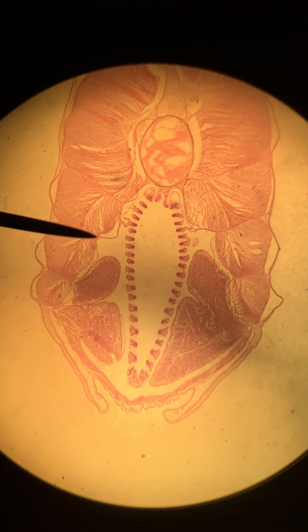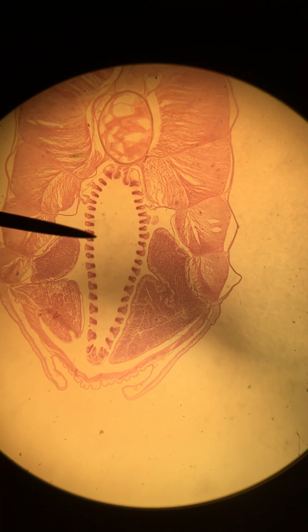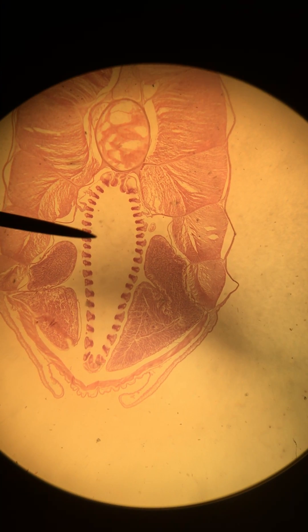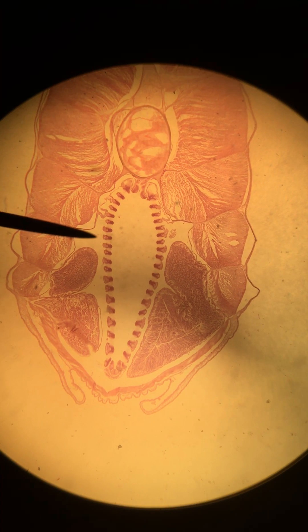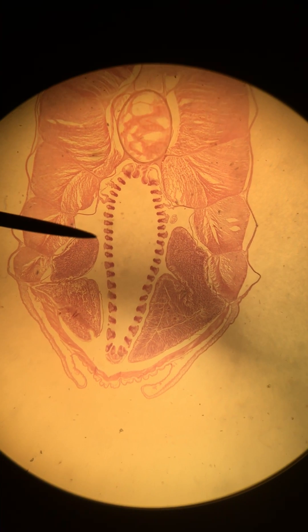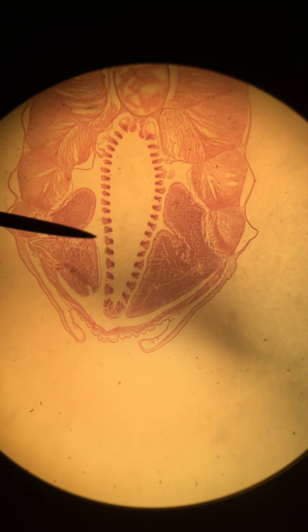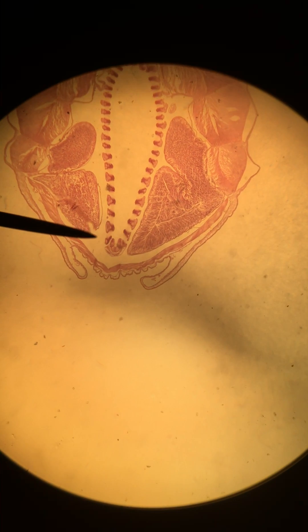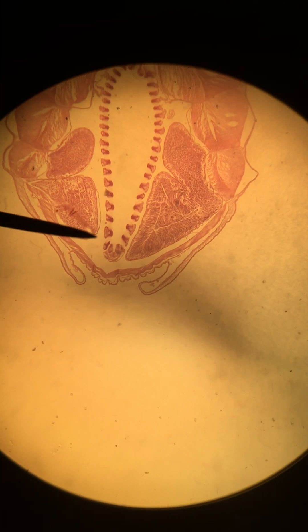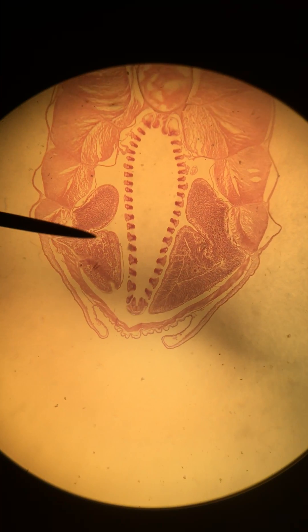You can see we're at a similar section to where we saw the ovaries in the female. We still have our pharynx with our gill bars and gill slits, and that is surrounded by the atrium — the space here. This is of course where water passes through the organism and goes out the atriopore.